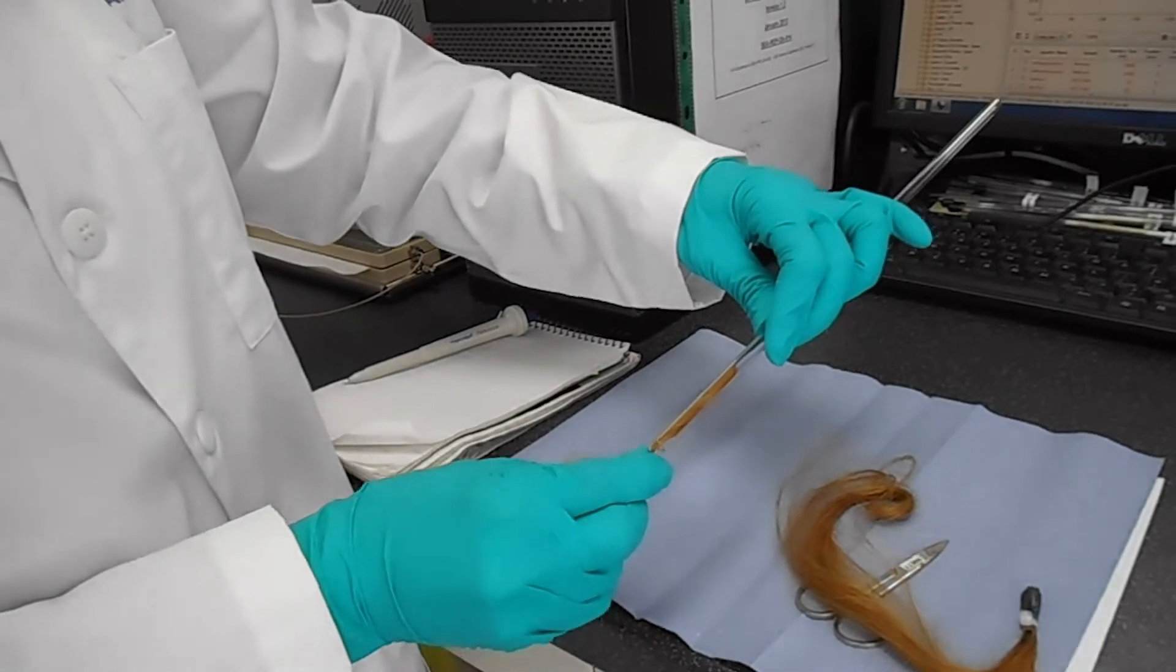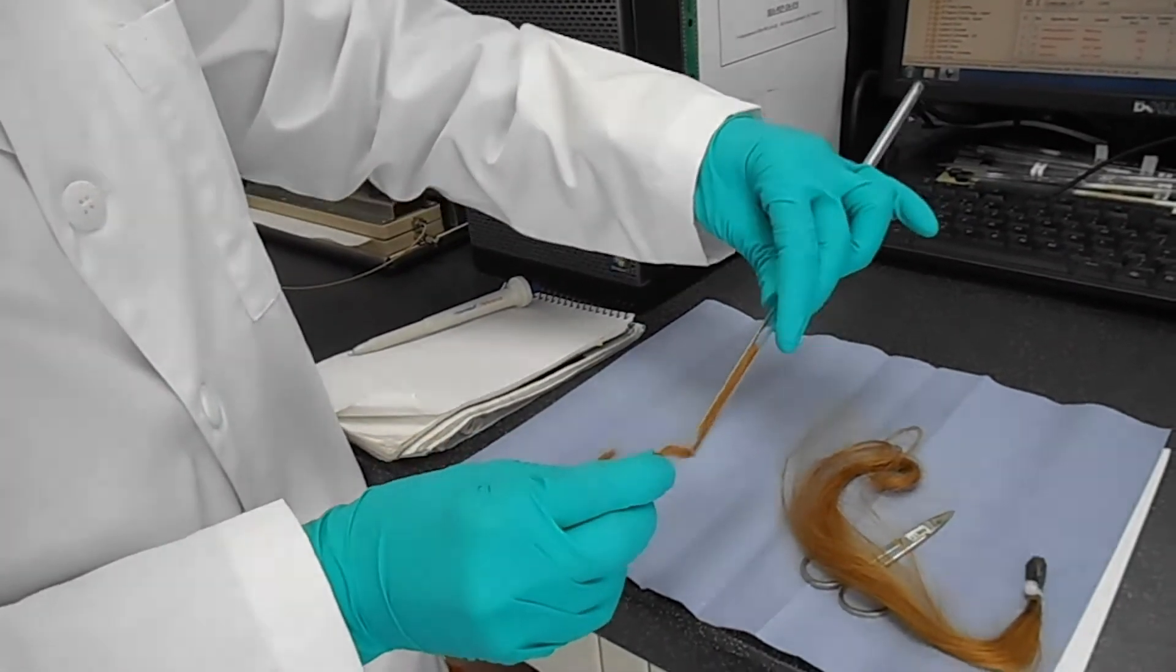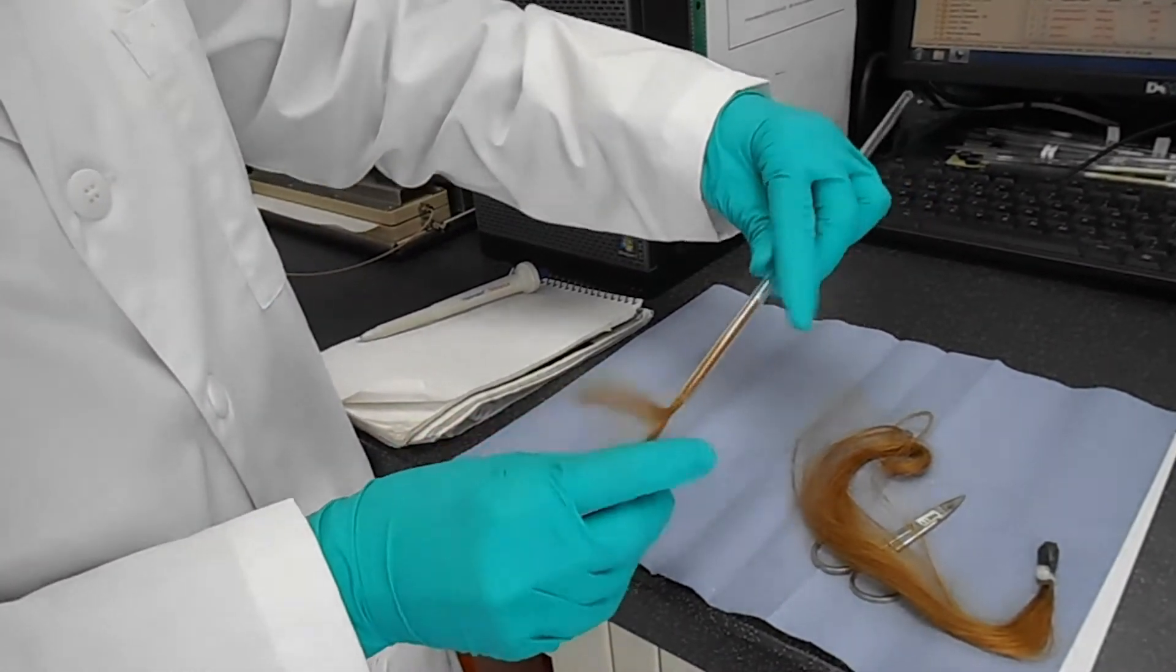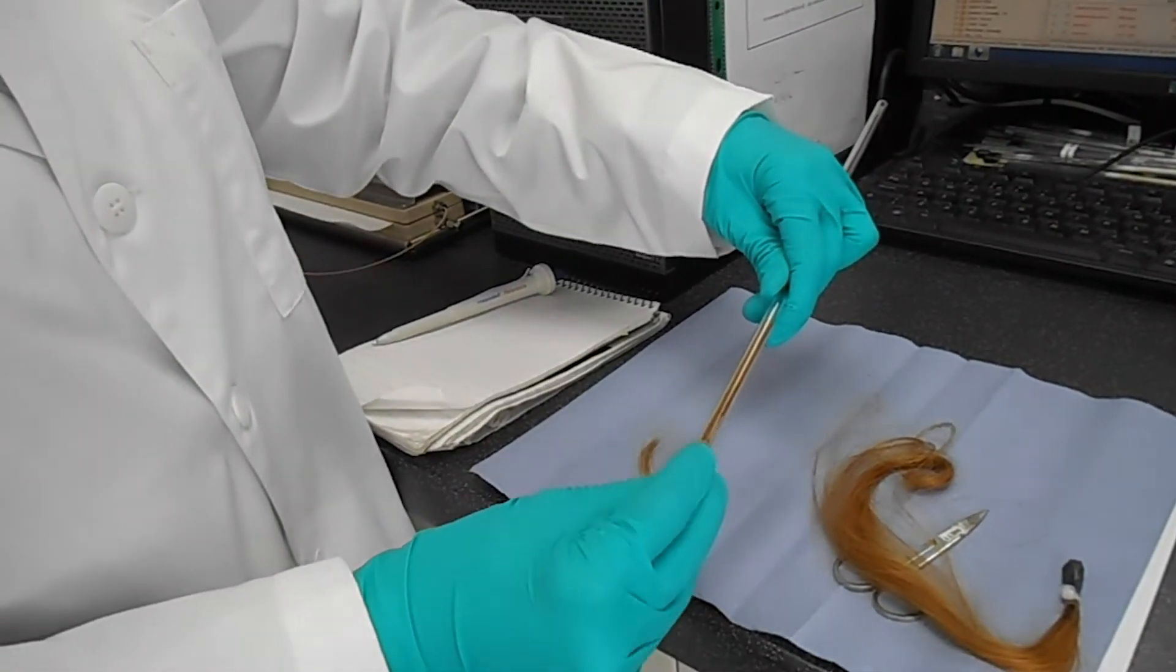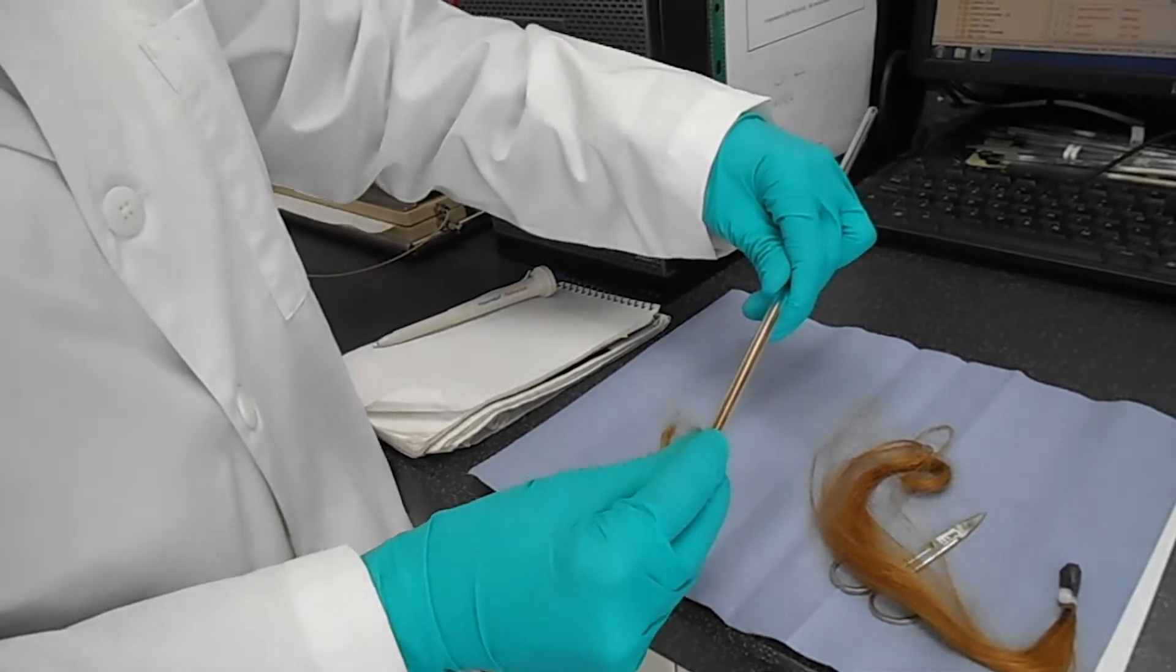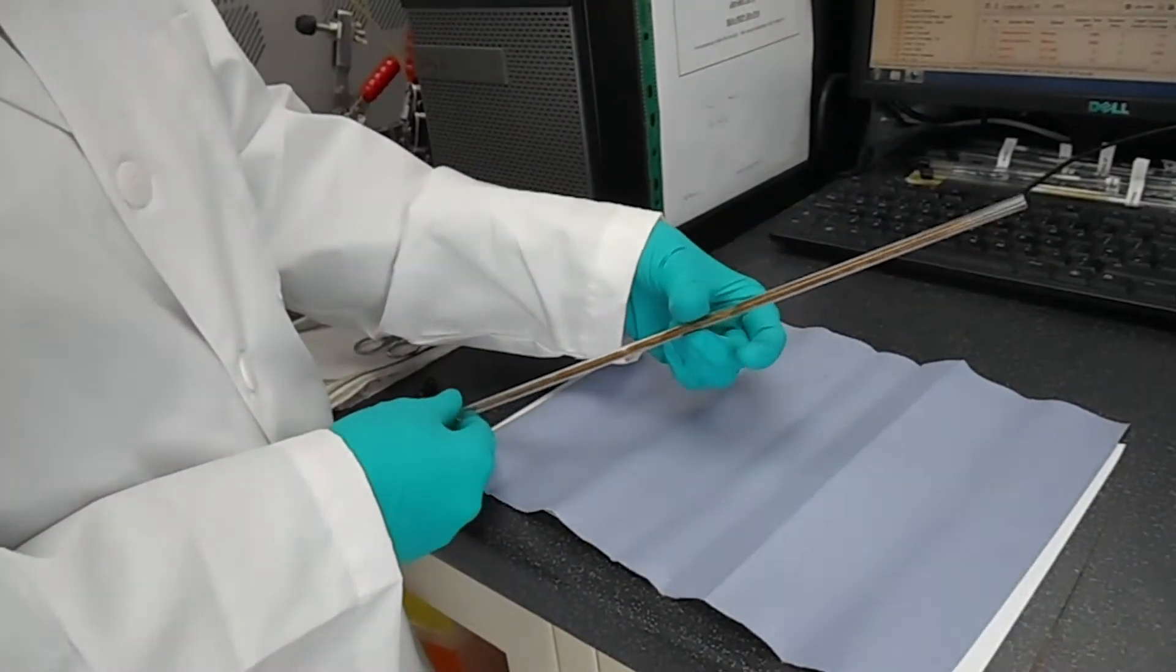Usually around one gram of sample is required for measurement of hair sample. We can increase the mass after the measurement by adding more hair inside the column with no problem.